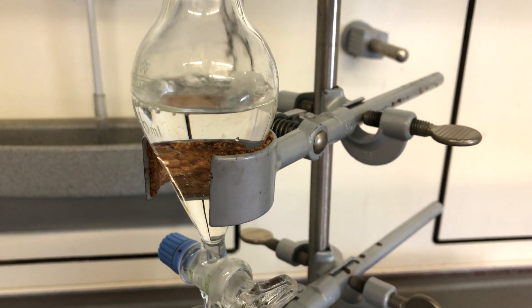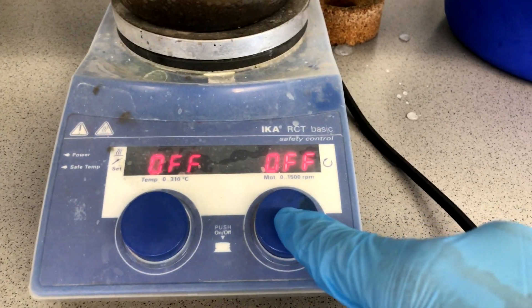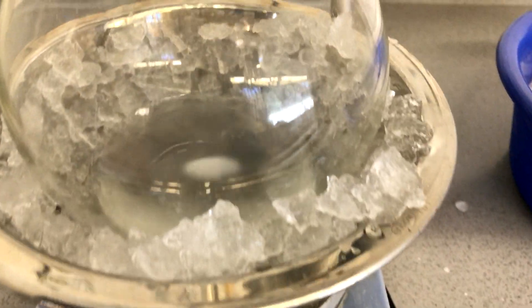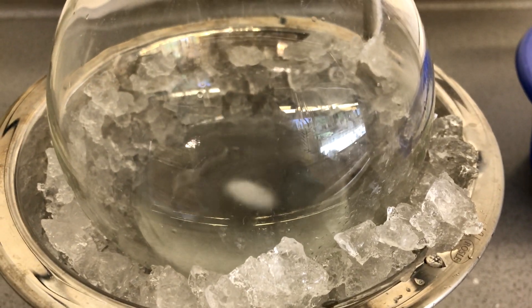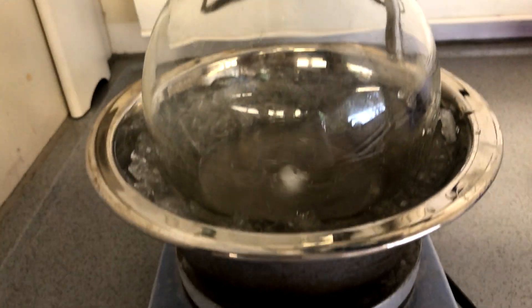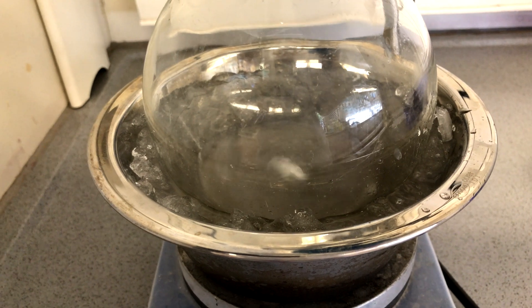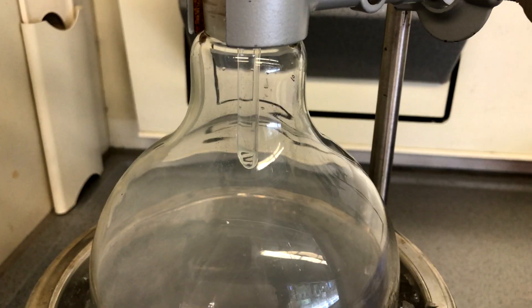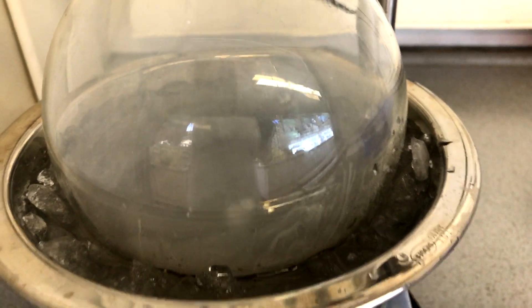We added the ammonia to an addition funnel, and below that we set up a magnetic stirrer and an ice bath. The temperature should be kept between 0 and 5 degrees Celsius, and therefore I added the ammonia over the course of about an hour. To keep the ice bath extra cold, I added some sodium chloride.